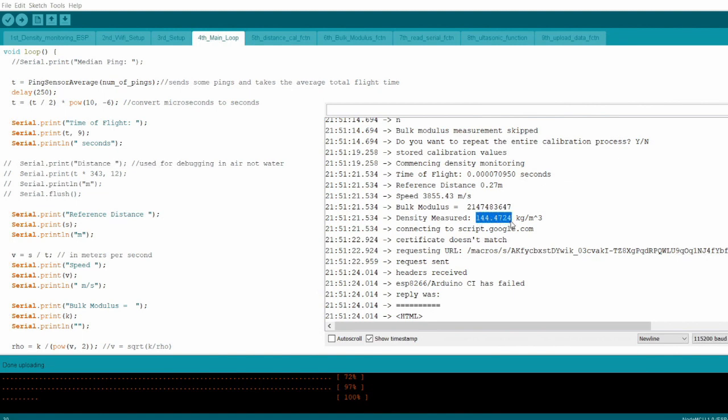So the bulk modulus, like I said, there's something wrong with that. If you can figure out why that was, let me know. I think I've got an idea as to what it is, but I'll make a breakdown video as to what I think happened there. But basically, this was resulting in a density measurement of about 150 kilograms per meter cubed, which is a good bit off what we know it should be. It should be about 1,060, the density measurement we took beforehand.